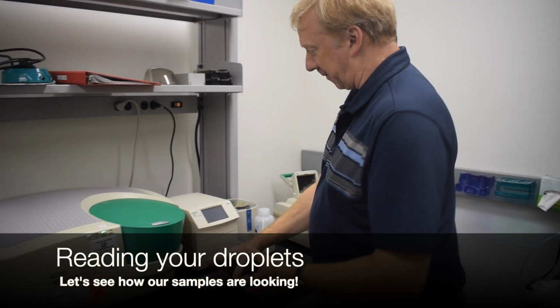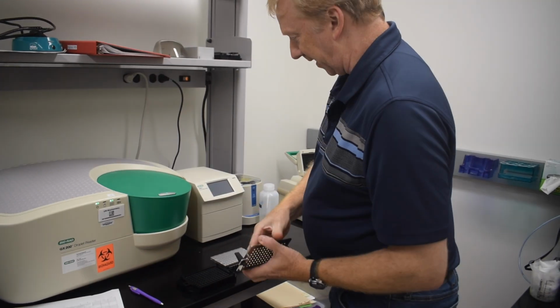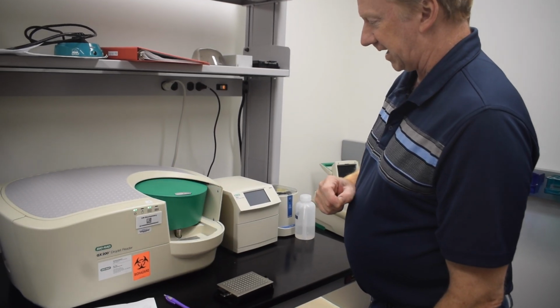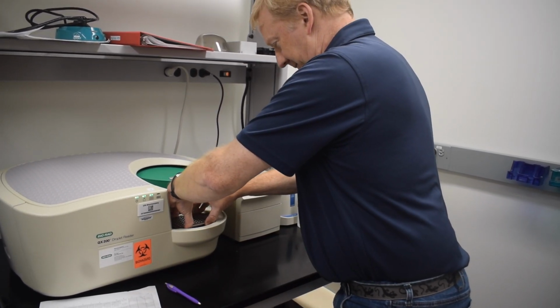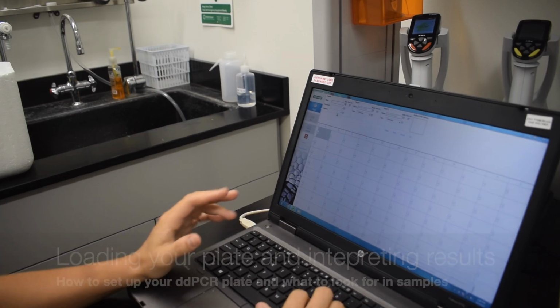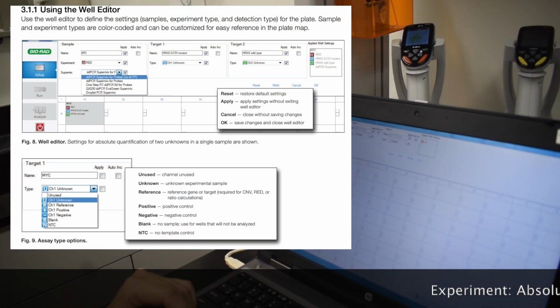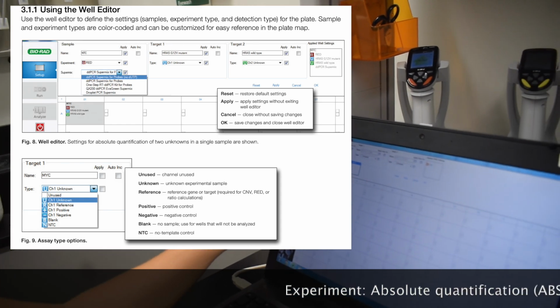Now we're going to load our PCR plate into the reader. So you take the holder, pop off the lid, place the plate in the holder, red stripe up, press the button on top, the machine opens up, this slips in, make sure that it seats in the bottom, and press the button again. Things that you should be mindful of when you're setting up the experiment that we'll touch on here. One is that we are measuring the absolute value. Two is that you are using that super mix, again, with no dUTPs. Very important.